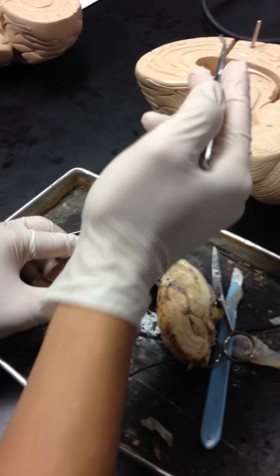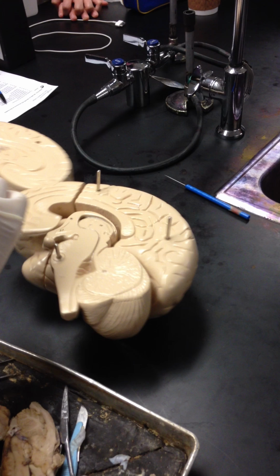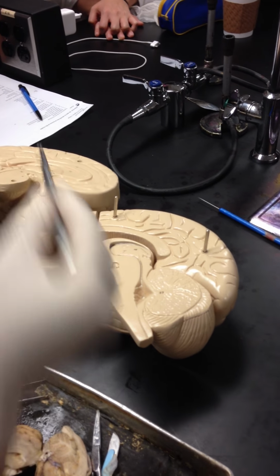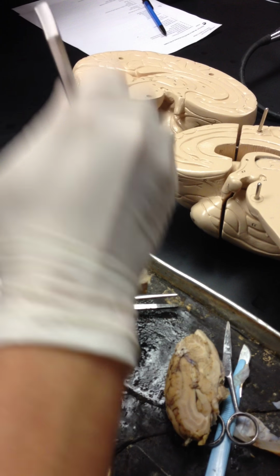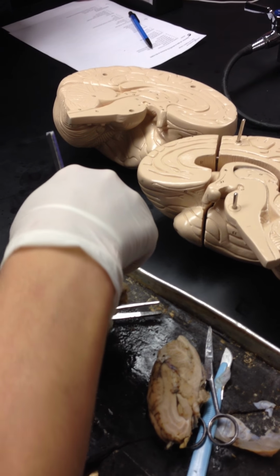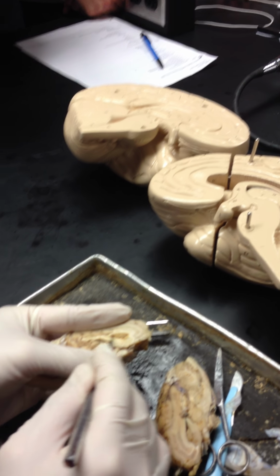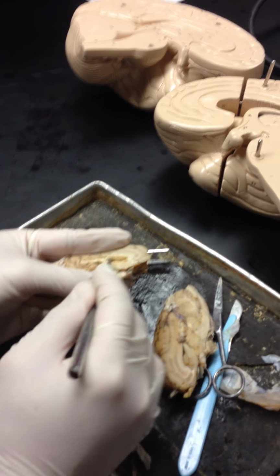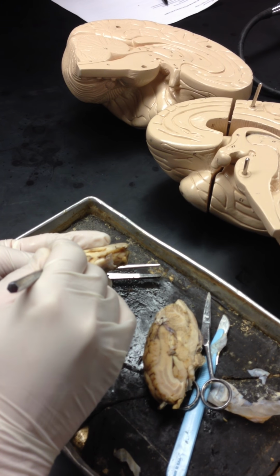Okay. Now, what you want to do is this. You want to go into the ventricle. This is called a lateral ventricle. But before you go in, there is a septum pellucidum. So in this case, this is the septum pellucidum. I would have to puncture it to go inside the lateral ventricle. Do you see that? So I puncture that. So you have the corpus callosum, you have the fornix, you have the septum pellucidum, and you have the lateral ventricle. Okay, I open it up. Do you see that?